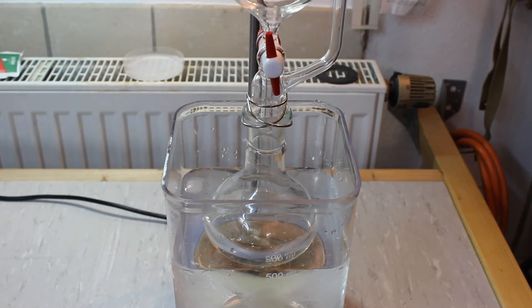All of the sulfuric acid has been added so we can now switch our setup to distill off our ether.